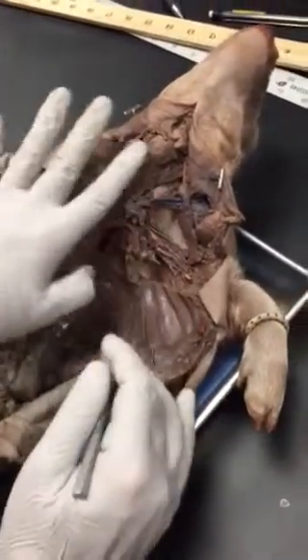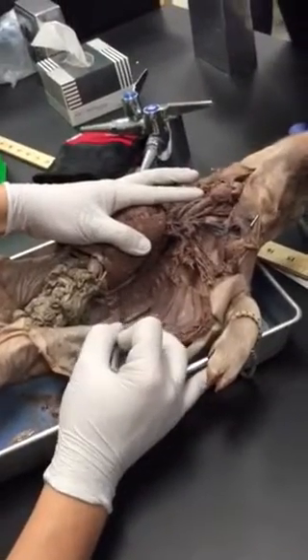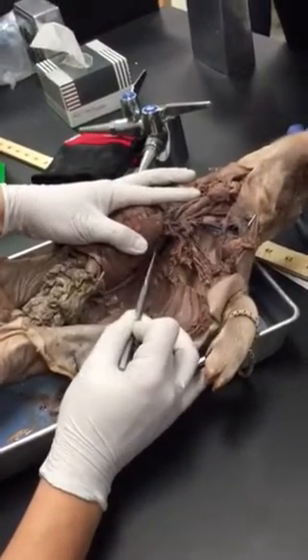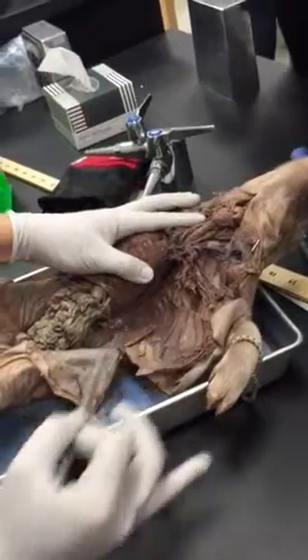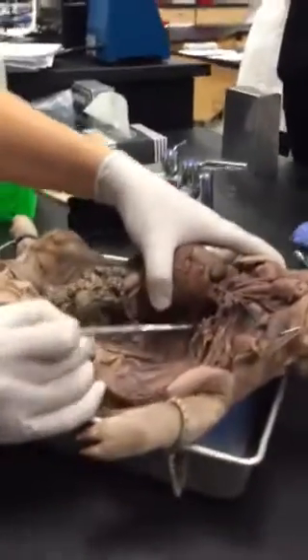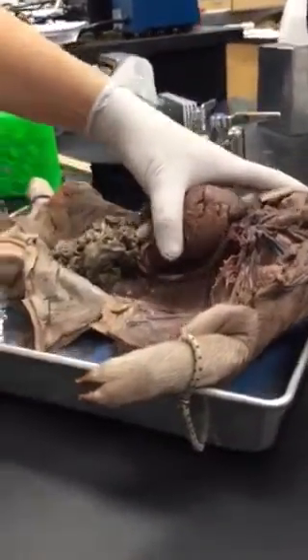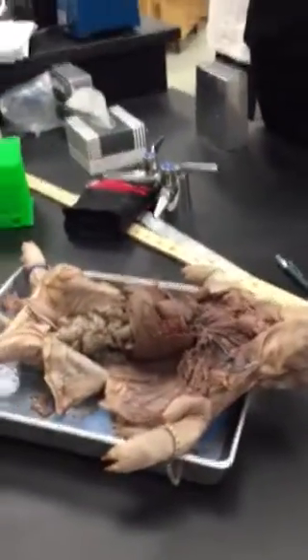Lastly, we can follow it curl back here. And when you pull this to the side, what you guys can see is here's your dorsal aorta here. You see that? Okay? You guys all good with that part? The dorsal aorta? Here. Yeah, here. Awesome. Okay, so now that we've got this top part done, let's do the abdominal part, which is over here.